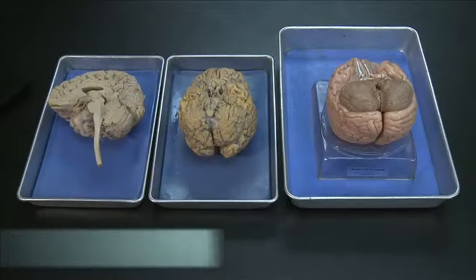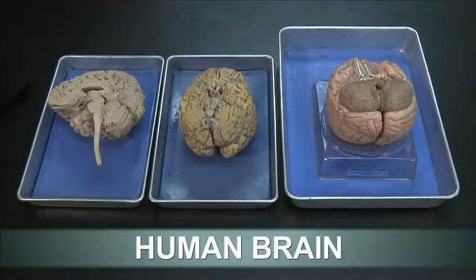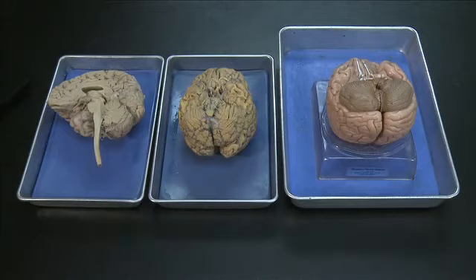This video will demonstrate how to orient when you are studying the brain, guide you through the major parts of the human brain, and demonstrate the location of the 12 cranial nerves.